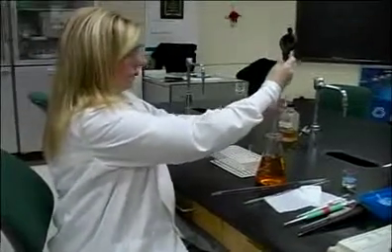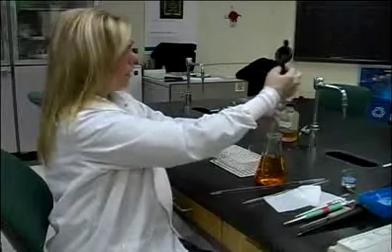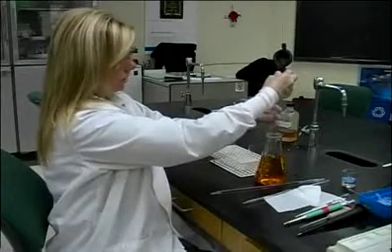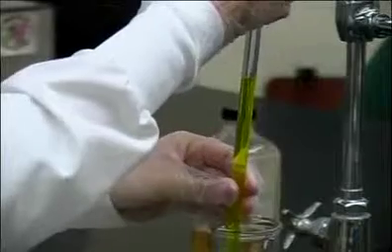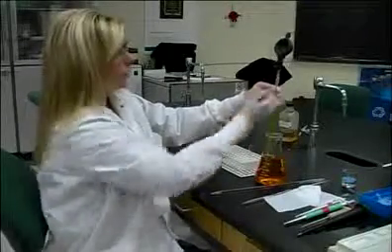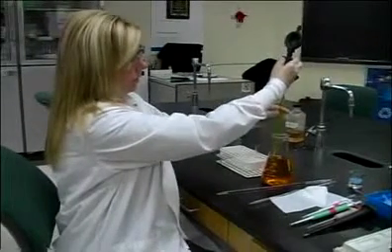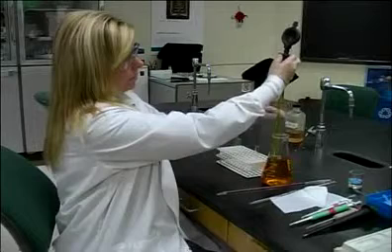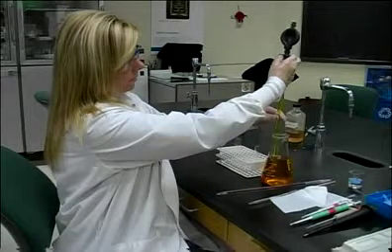Put your pipette into the liquid, and you're going to hit the S on the pipette bulb for suction. And you'll notice that the liquid then comes up into the pipette. In order to get it to the desired level that you want, you would hit the E, which means evacuate. So if I want to dispense 10 mLs, I'm going to bring it up to the 0 mark. Evacuate down to 0.